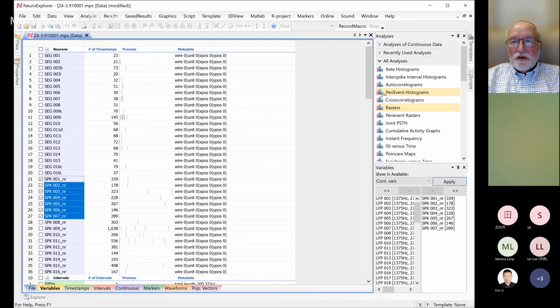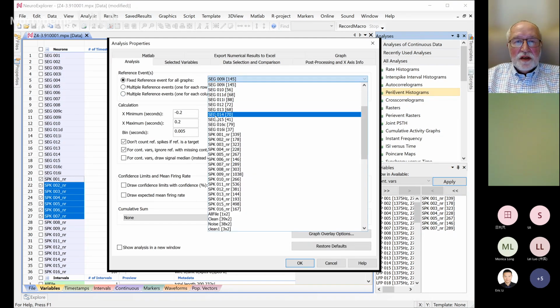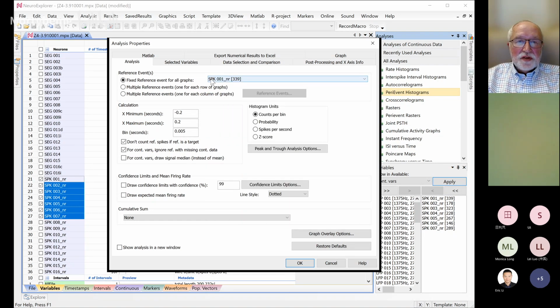Sorry for the delay. Okay, so it's perievent histograms. You select the neurons, then go to perievent histograms, and here you can specify a reference, which will be your stimulus if you have one, but you can also specify a spike train. Let's take the first spike train as a reference. This analysis calculates relative spikes, so bin counts for the spikes that happened before and after relative to the spike in SPK 001 NR. We say we want 200 milliseconds before, 200 milliseconds after, and each bin is 5 milliseconds.